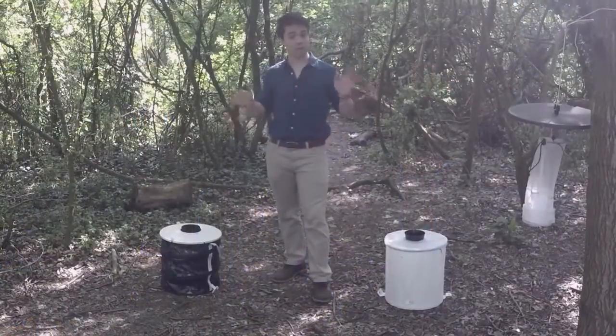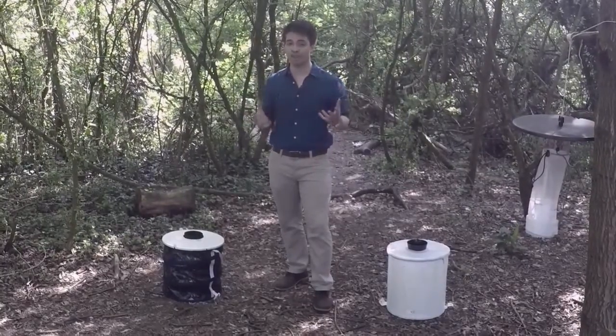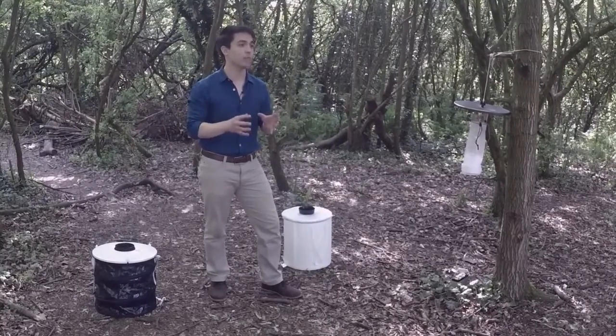There are many different types of trap for adult mosquitoes and the one that you choose will depend on which species you are targeting and what the purpose of your trapping program is. With this in mind I will start by discussing the importance of understanding the basic biology and behavior of the mosquito species that we want to collect. Next, using this information, I will discuss how we can exploit these behaviors to collect the mosquito and provide a rundown of the most commonly used mosquito traps for Aedes mosquitoes. Finally, I will also highlight some of the many challenges involved in actually conducting a mosquito trapping program in the field.